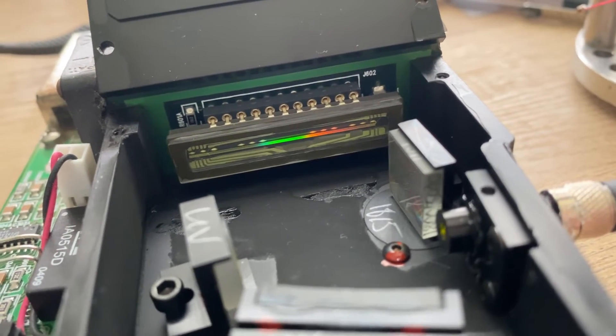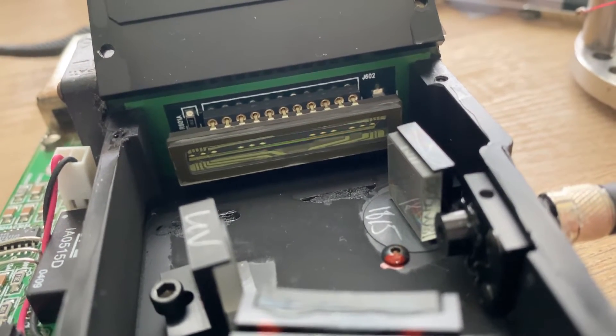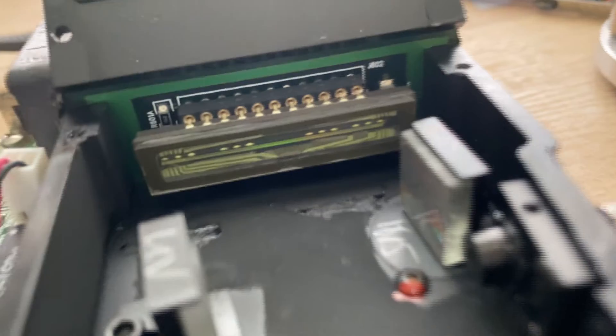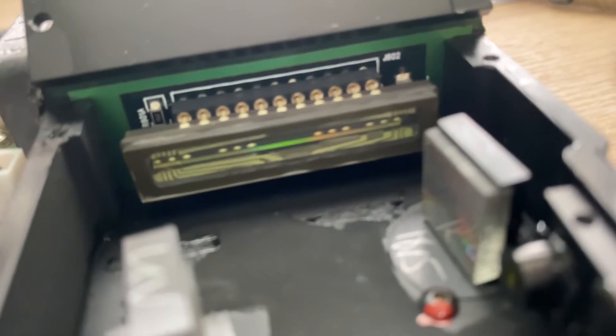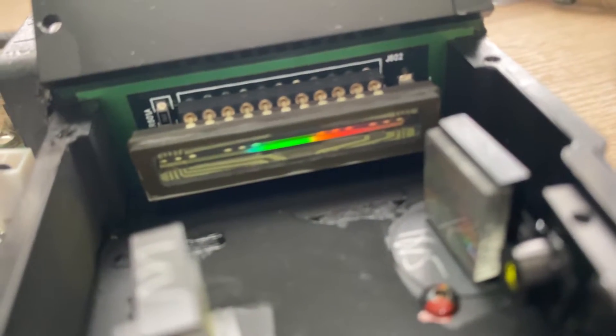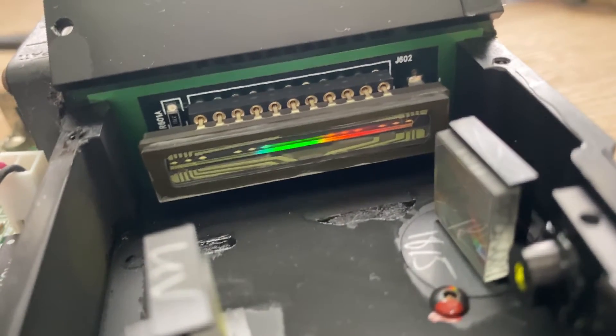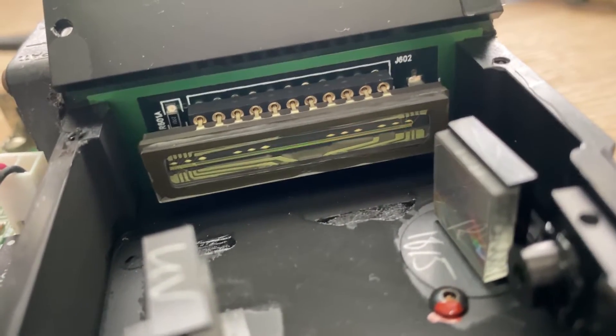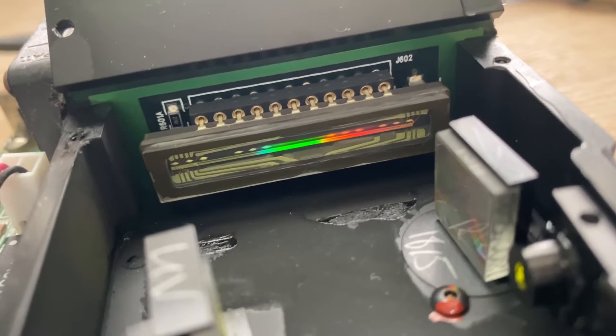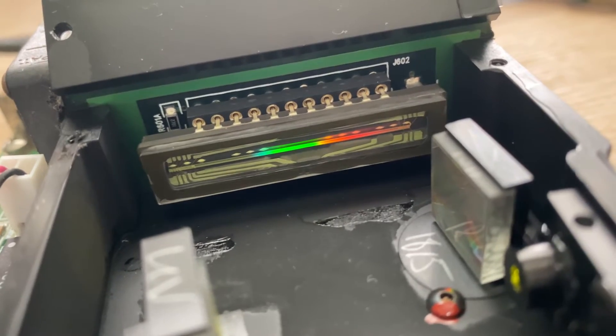Then, when I tested it with a white light using a cell phone flashlight to check the full spectrum of visible lights, you can see that the spectrum covers the whole sensor region, but it shifted towards the right.